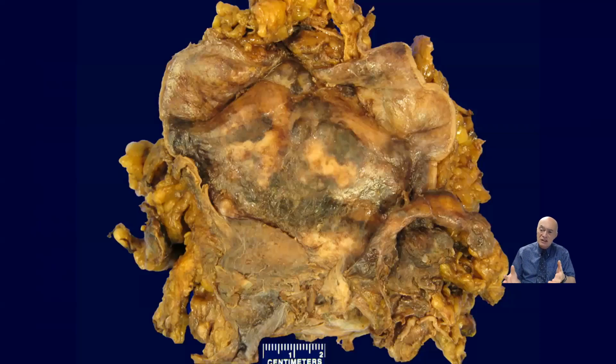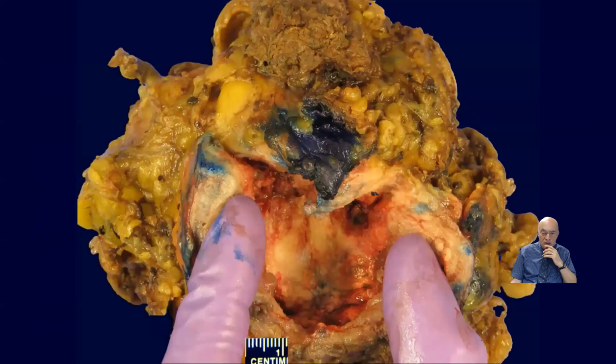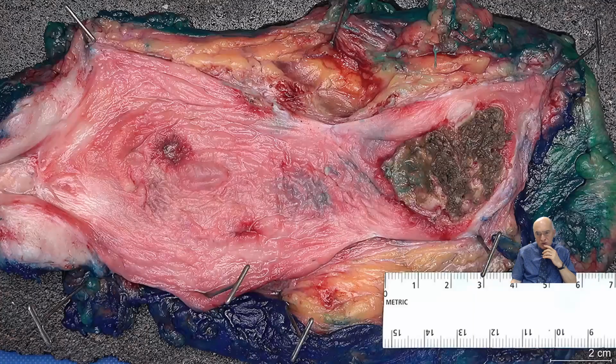You can describe them as nodular formations or a scar or ulcerative sections, lesions, but try not to give them the nature of the lesion, especially in regards to the presence of malignant tumor, when it's only the gross examination that you are assessing. These are just other pictures, just to document some with nice pictures and the presence of these tumors.